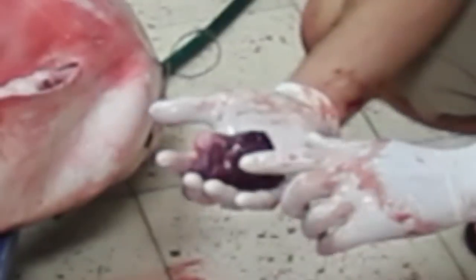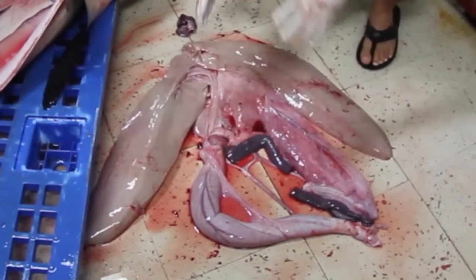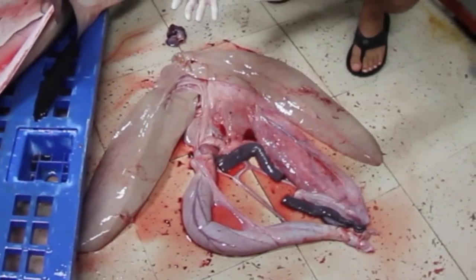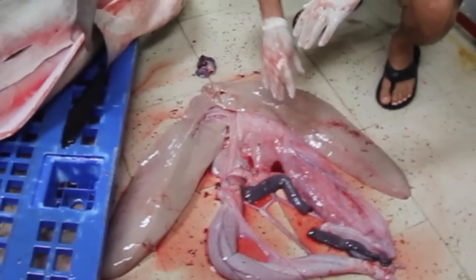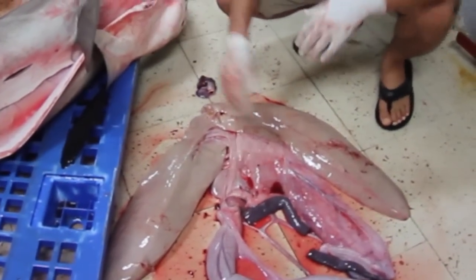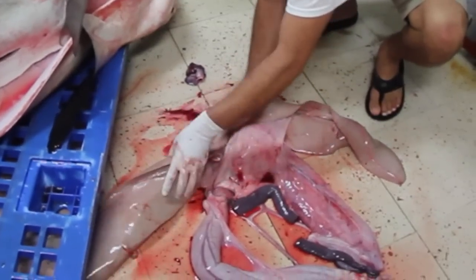Here we have the heart. Here we have the two lobes of the liver — they are quite large in the shark, because the liver is what they use for buoyancy. In this case it produces a very low density, and here we have the vesícula.